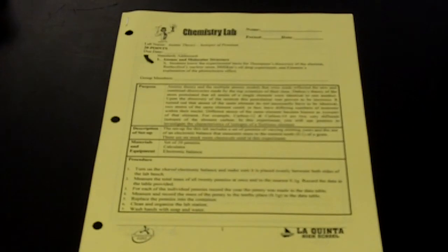Materials and equipment: a set of 20 pennies, a calculator, and an electronic balance.